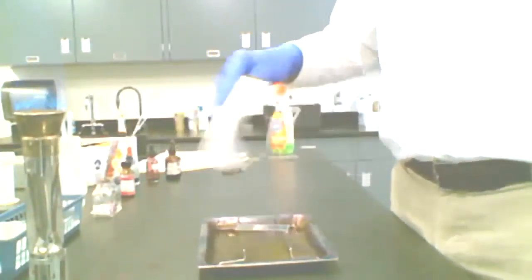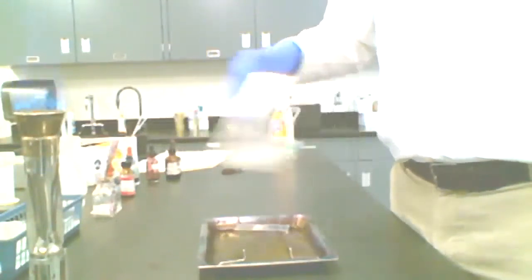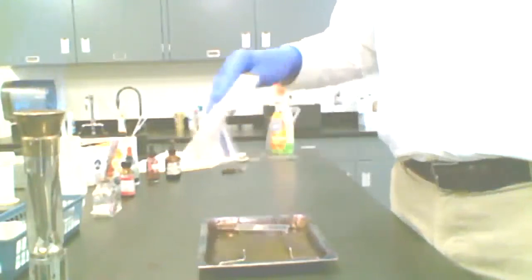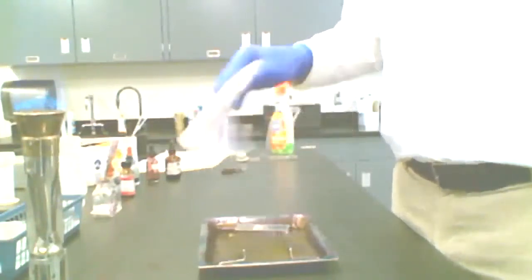Are they in chains? Are they in clumps, little random clusters? Are they in pairs? What sort of arrangement do they have? That's very helpful, and it varies considerably between species. So really thick smears reduce your ability to see those things sometimes. All right, so that's pretty much dry.